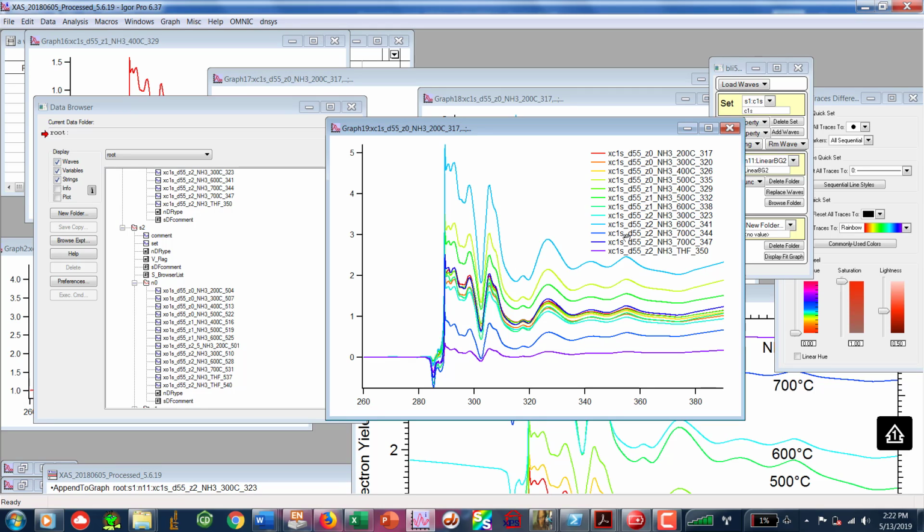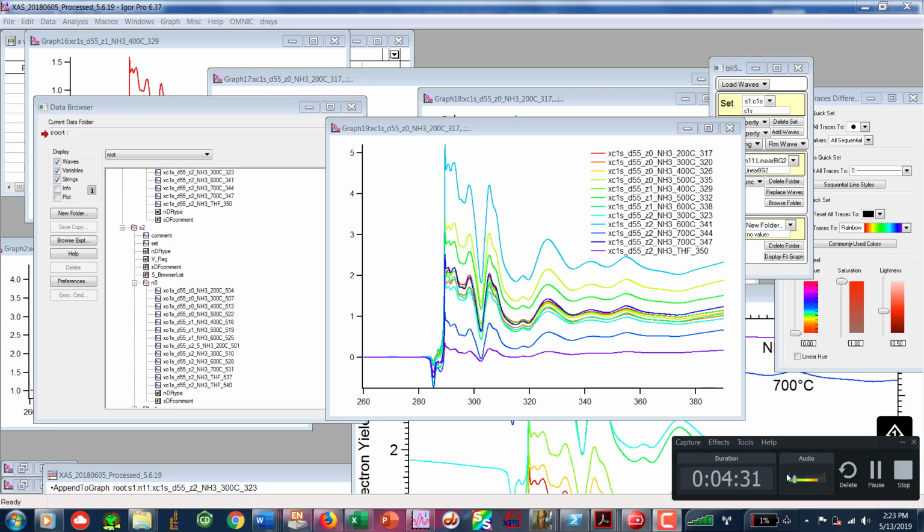Now from my notes, the atomic normalization that I have, you'd assume would be at that high energy level. You know, it has to be from the edge back to 390 or something along those lines. So this should move us in the right direction. We should both be seeing this prior to atomic normalization. So I'm going to go ahead and stop doing this, and I'm going to send it your way, and you let me know what you see. But I think we're closer to what we should be achieving here.